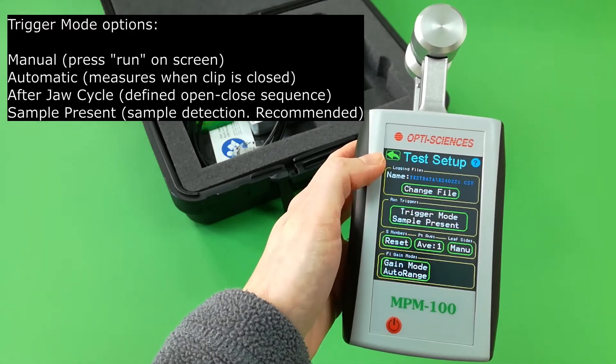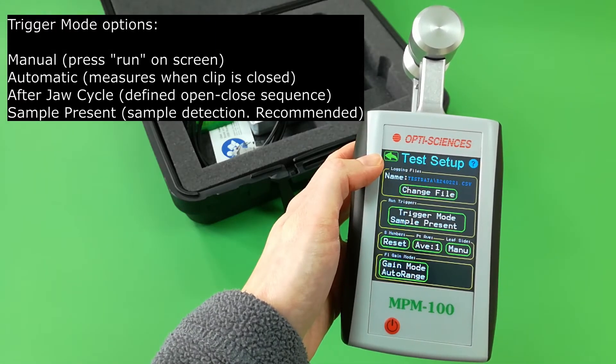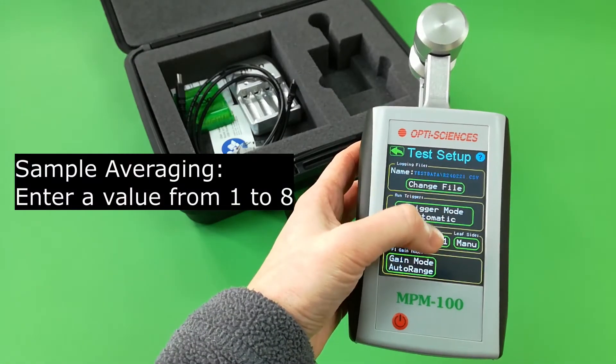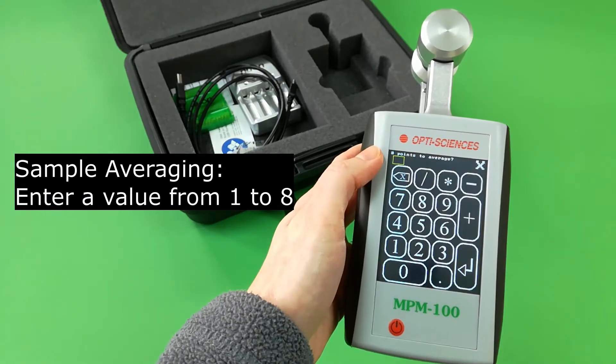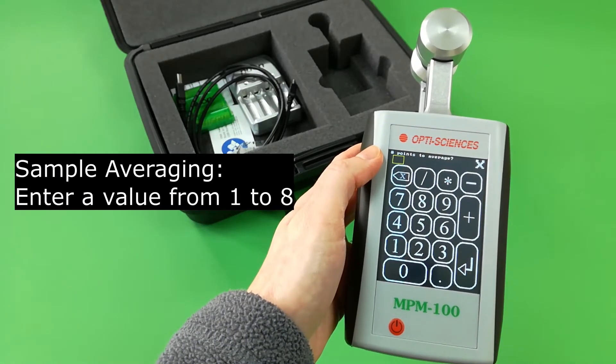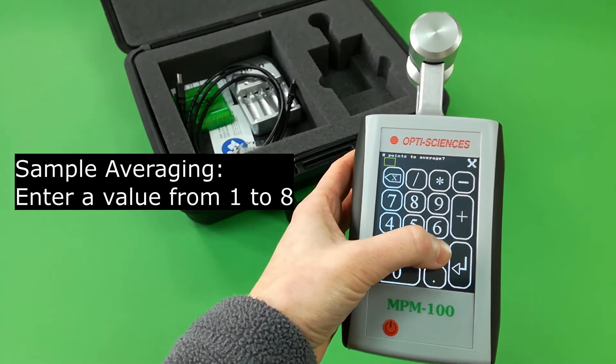Sample present is the recommended intelligent mode. Press sample averaging to enter a value from 1 — no averaging — to 8.